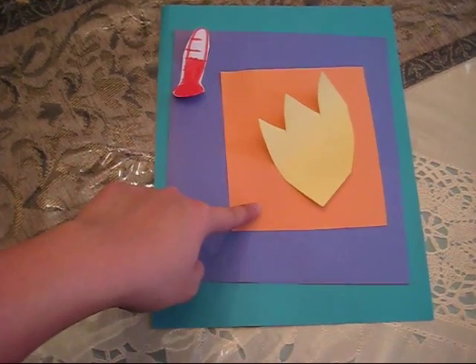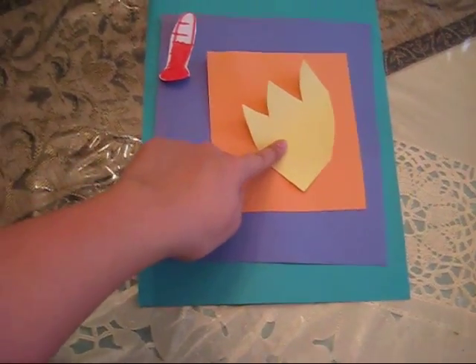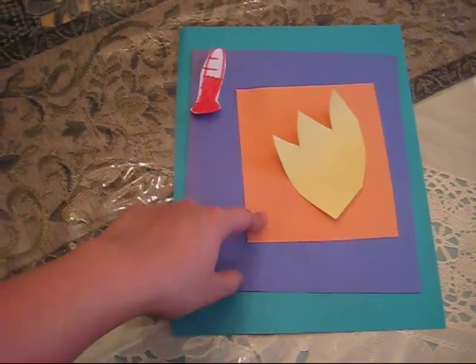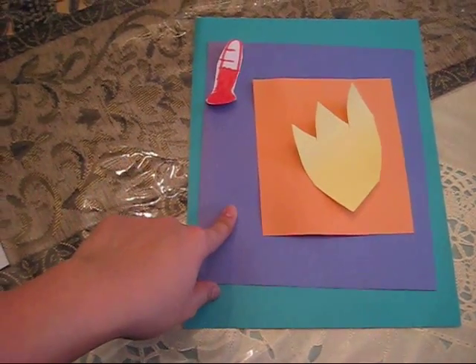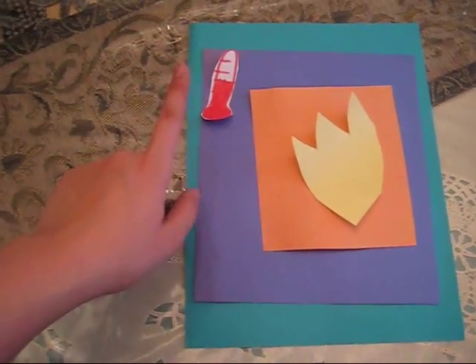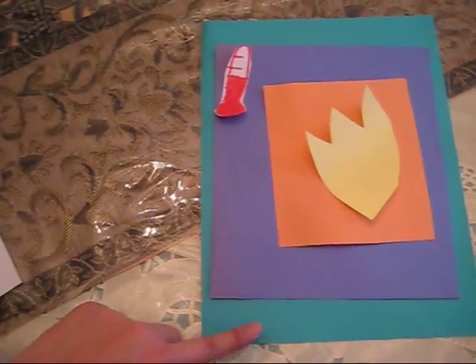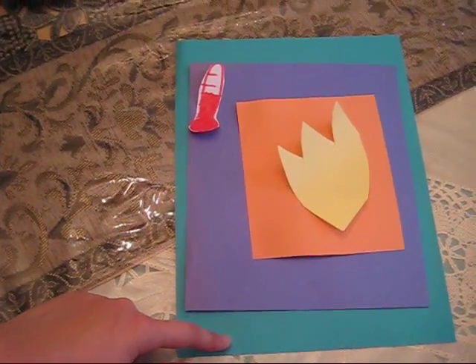The vessel is filled with oxygen and then ignited, so the material inside combusts. Temperatures can reach 1,000 degrees Celsius. The heat from the closed vessel is transferred from the conducting steel around it to the insulating water. The temperature in the middle vessel is measured before the start of combustion and also taken at the peak of the heat — the highest temperature that it reaches. The third vessel of water is simply used to insulate and keeps heat from going into the vessel or out.